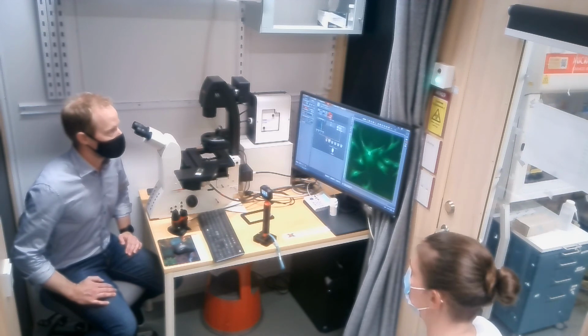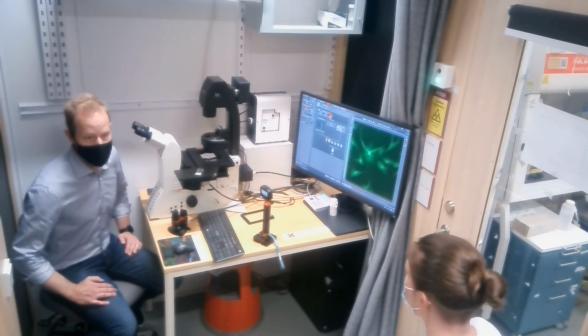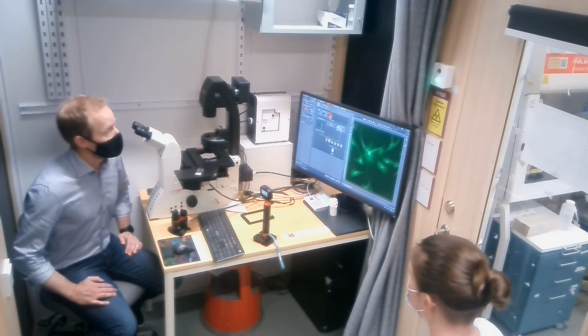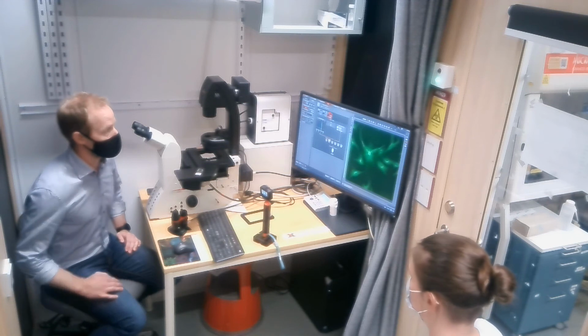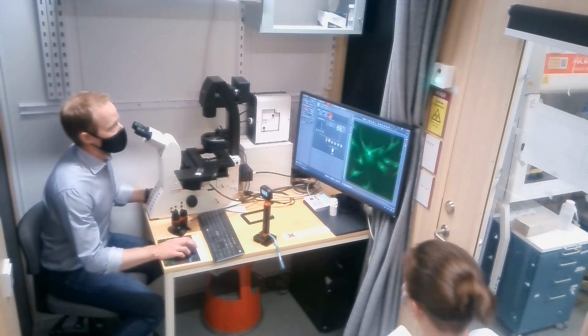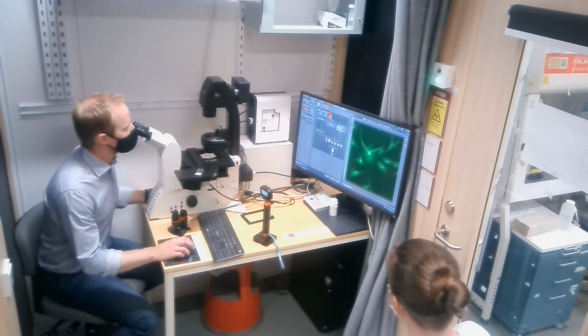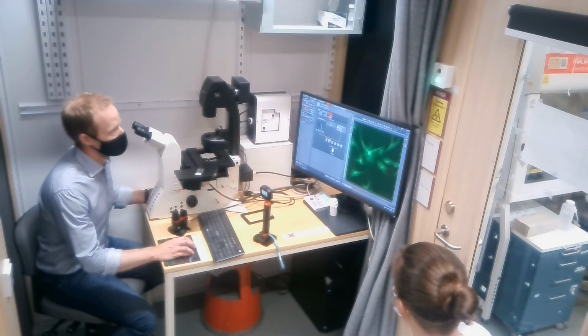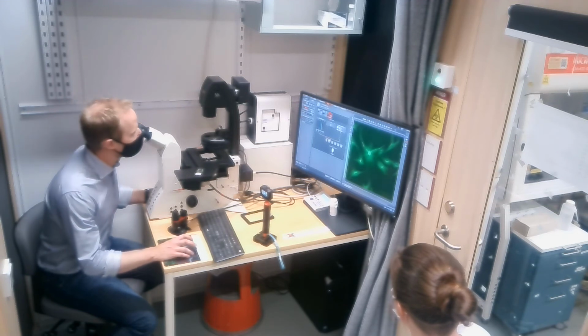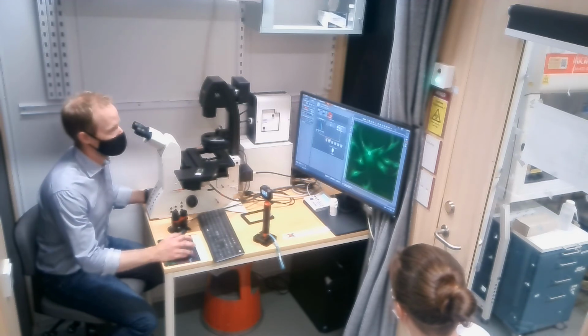All right. So now this afternoon, I was thinking we will move over and have a look at Navigator, set up experiments in there, and we will use most of the things that we've covered in the morning. So I will use the same sample for this. So I have my 3 probes here. I set it up using these quick selections. And right now I have the 5x objective, so an overview objective.